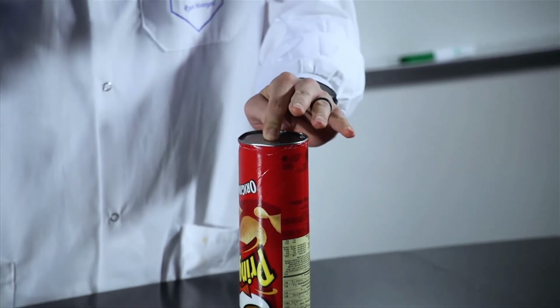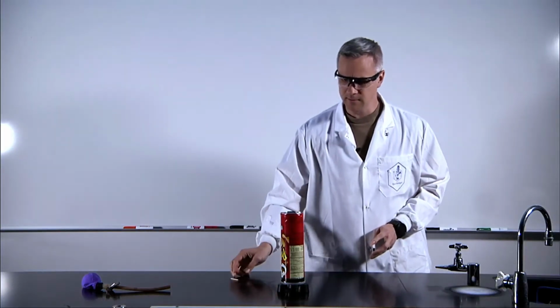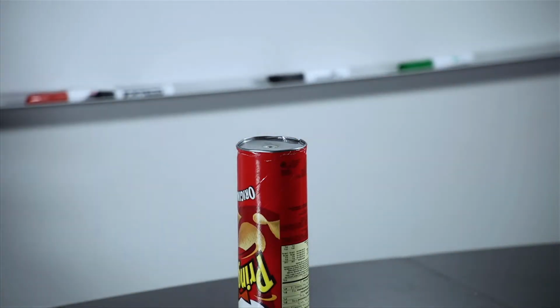Everybody ready? Oh. Okay. That's weird. So as we're waiting for this, because it should go, I don't know what's going on right now, but as we're waiting, what do we need again for a combustion reaction to take place? We need the fuel source, the oxidizer, and the source of heat, right?